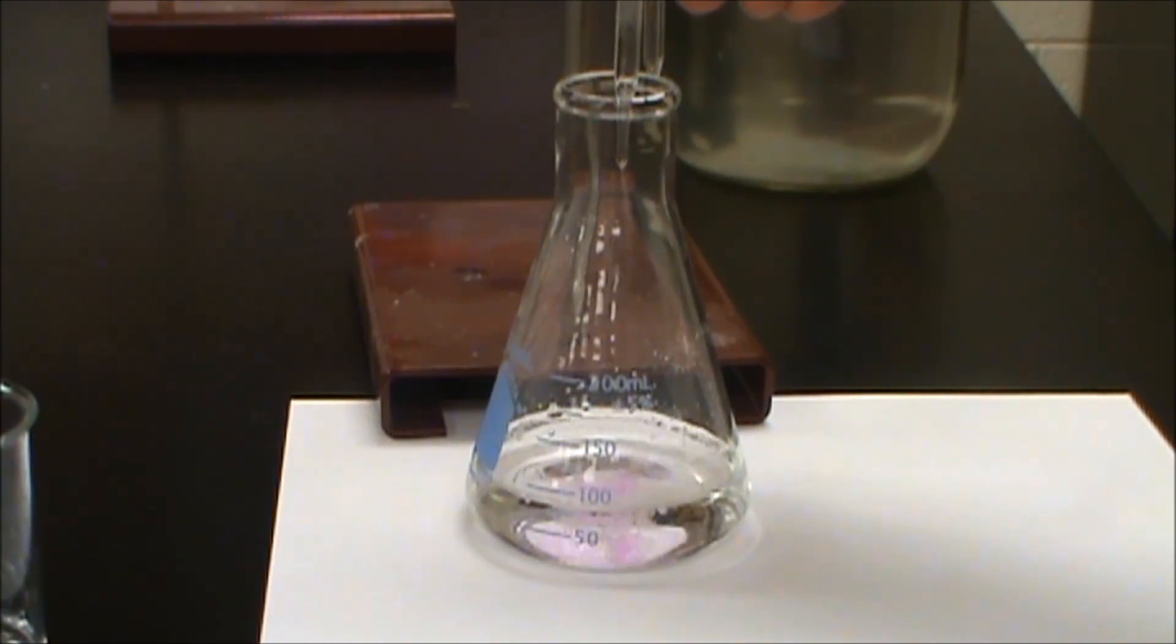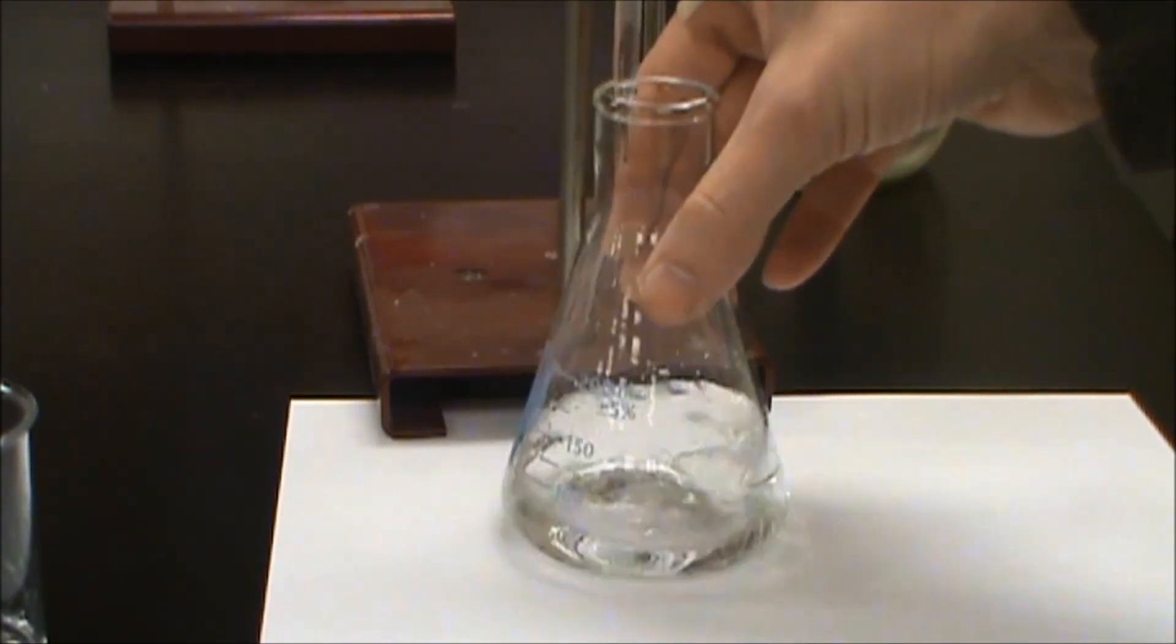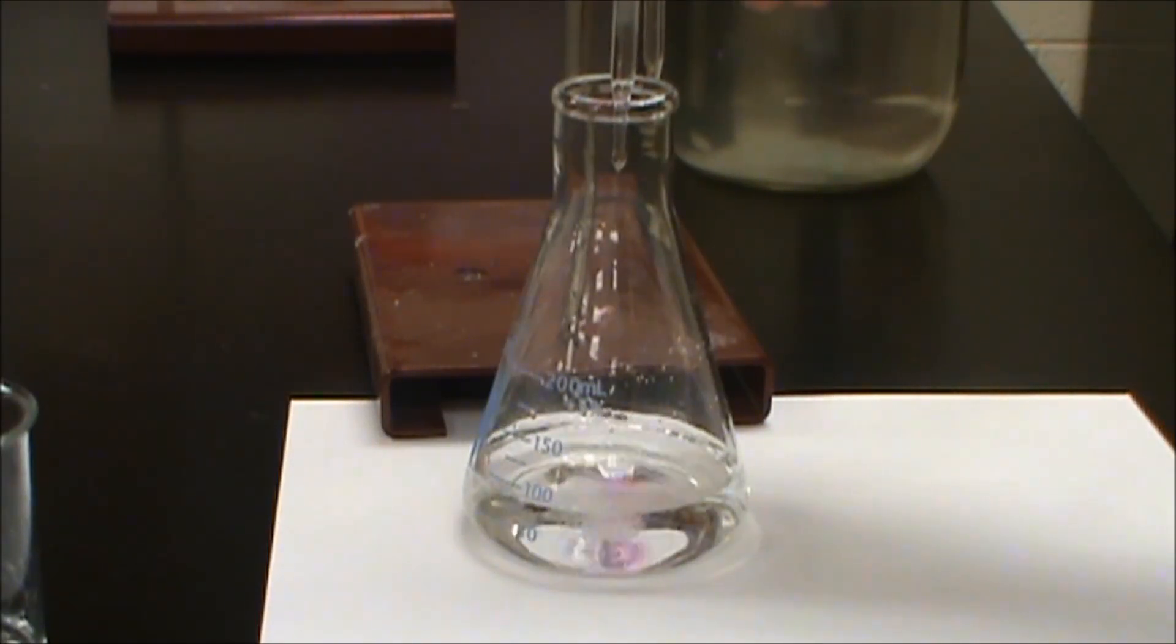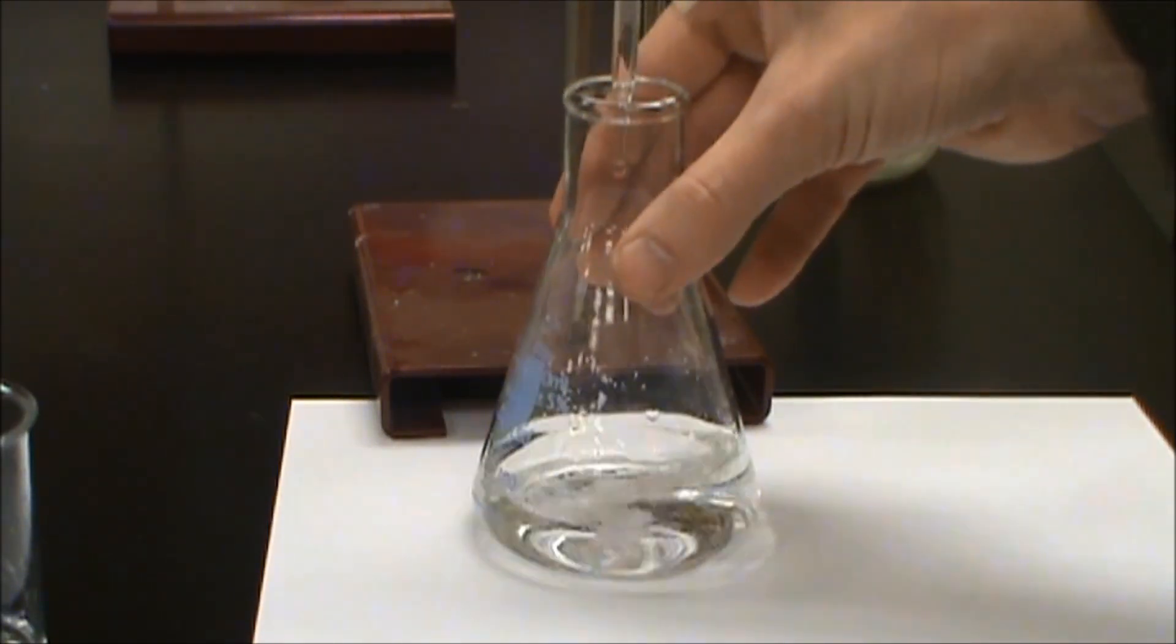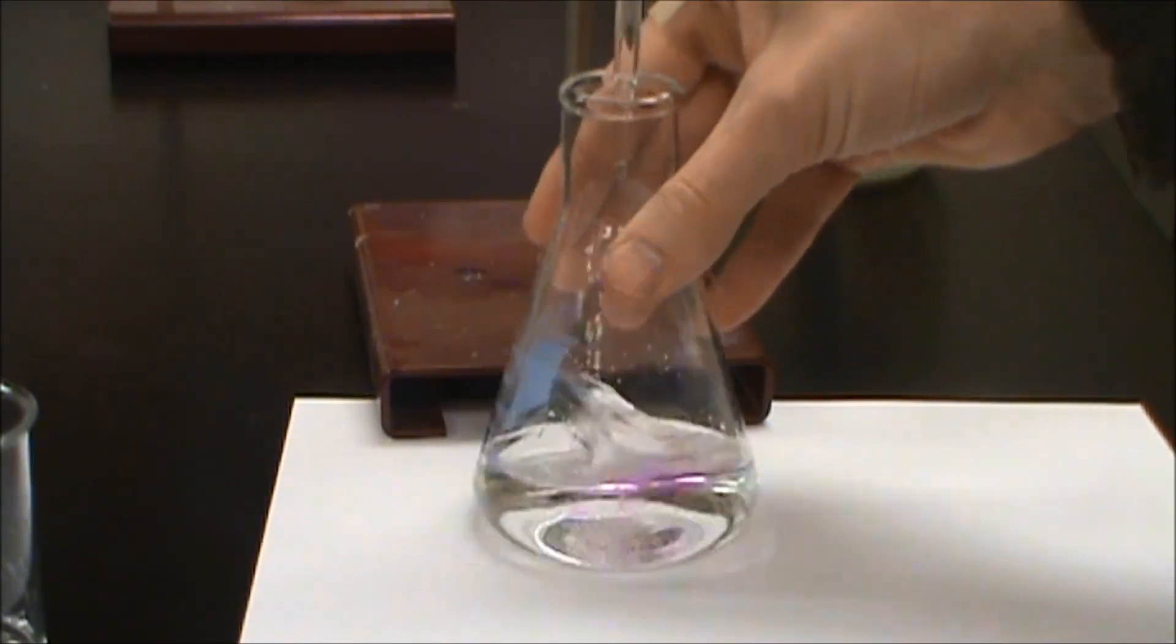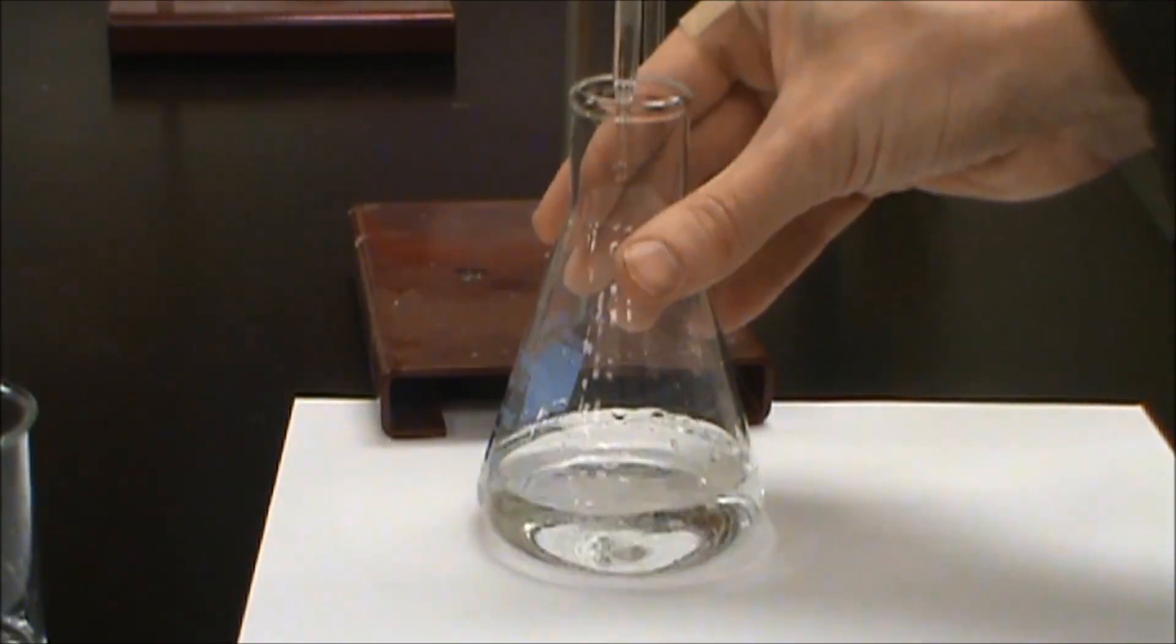Now of course I'm not the most patient for titrations. I do them a lot. What we want to do is we want to get it where it just changes to the pink color and persists. Instead of having some add in there and then seeing the pink in a region that disappears when it gets swirled.